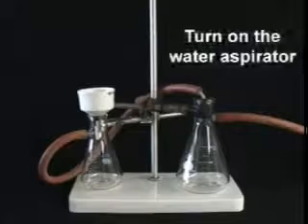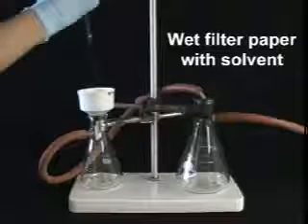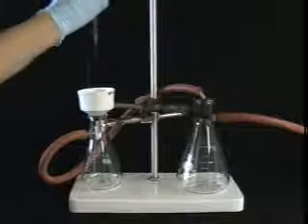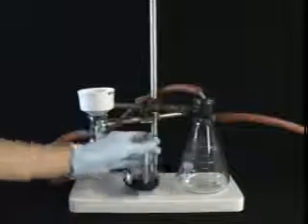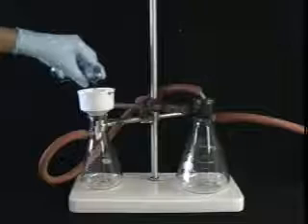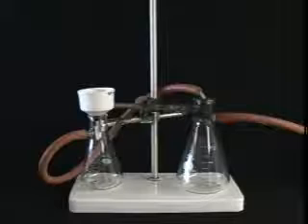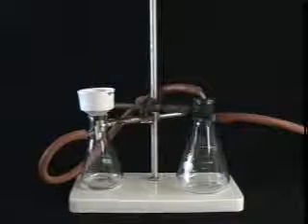So now it's time for filtration. Turn on the water aspirator at full force. The vacuum should suck down the filter paper. Wet the filter paper with solvent so that it sticks to the base of the funnel. You don't want it floating up later. Here's our mixture to be filtered. Take the mixture and pour it into the funnel, but make sure that you pour the mixture into the middle of the funnel. Don't pour it in all at once. Pour in more of the mixture as the filtration progresses.